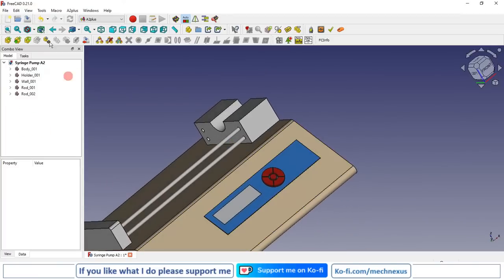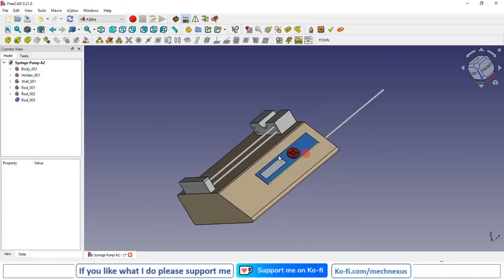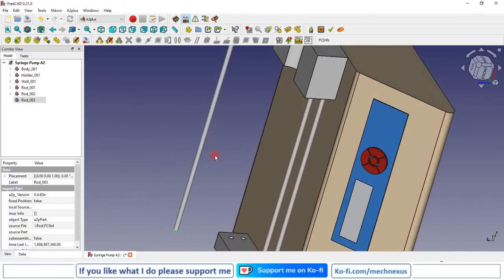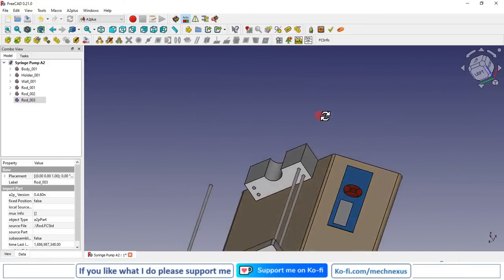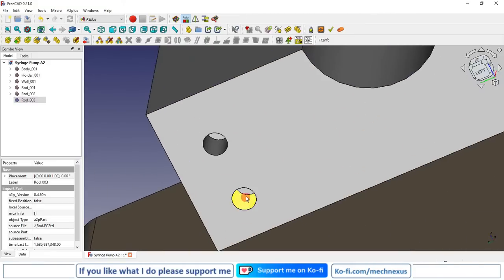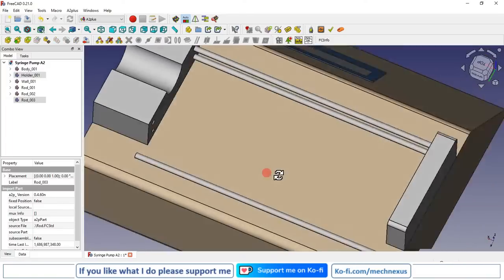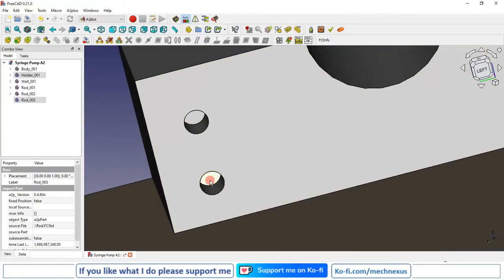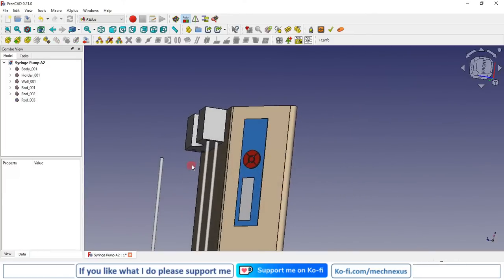Now again we insert one more rod, insert, I will select the face, I will select the inside face, and face has been selected. Let me select the face again.